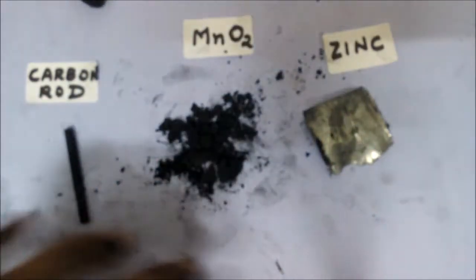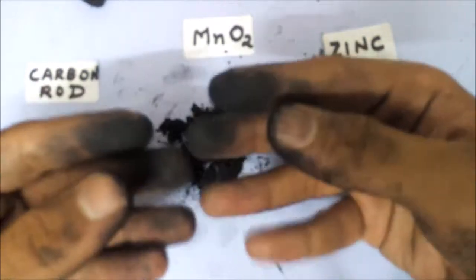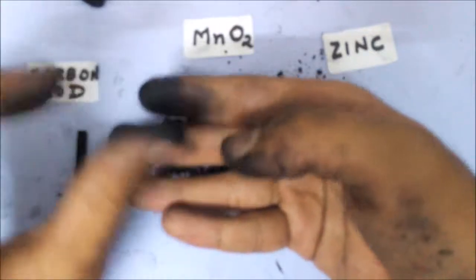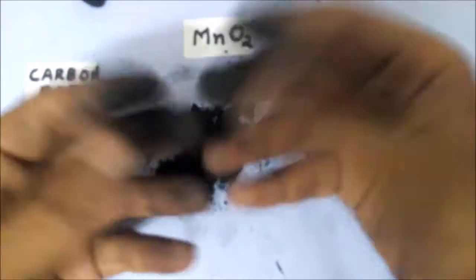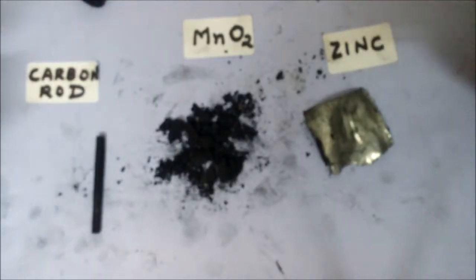And if you can see, I have stained my hands terribly with this manganese dioxide. Though you can go for gloves when breaking out the cell, I can wash this off by applying some vinegar over it, which will dissolve the manganese dioxide. The acid in the vinegar will dissolve these stains and it will be fine in just a moment. You can use these to update your science lab at home itself.